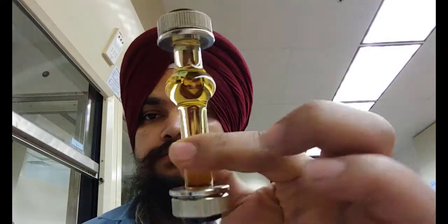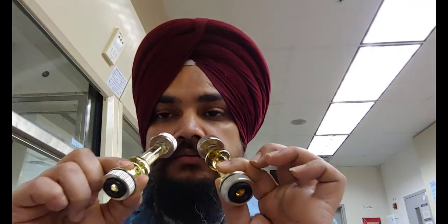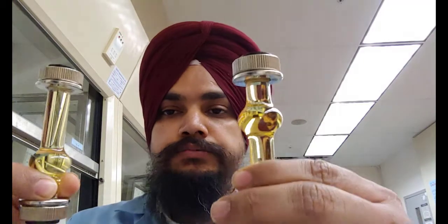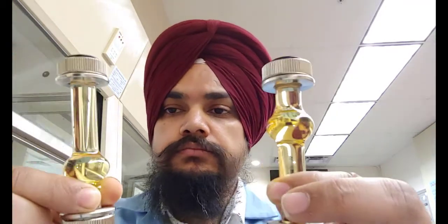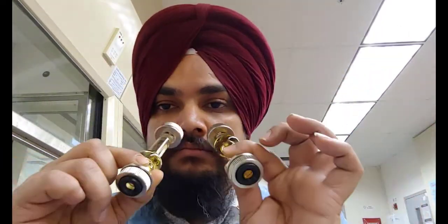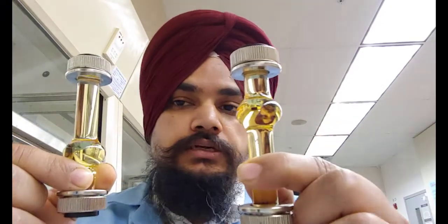These Carvone molecules look quite similar physically. So for example, this one is negative Carvone and this one is positive Carvone, and if you smell them, they both smell minty. In fact, they are present in spearmint oil and peppermint oil. So I cannot distinguish by smell. Some people can, but to me the fragrance is exactly the same. But their optical rotation is totally different.